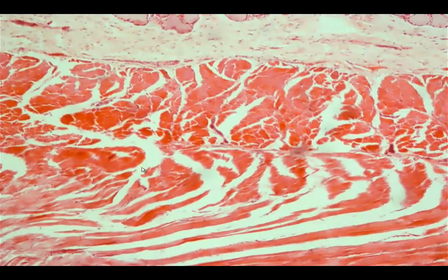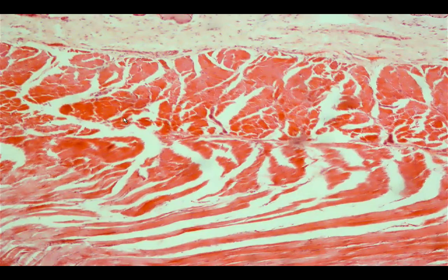And then this would be the muscularis propria, which would contain the muscle fibers. And then the outermost portion would contain the fibroadipose tissue. This would be called the adventitia. So this muscularis propria is the one that we need to look at. You can see the presence of skeletal muscle fibers. And skeletal muscle fibers would be present in the upper region of the esophagus. So this is the slide for the upper region.